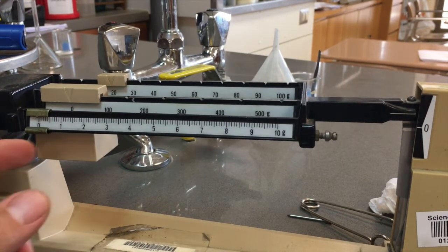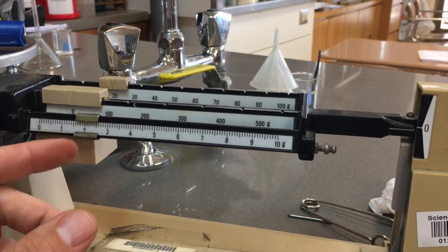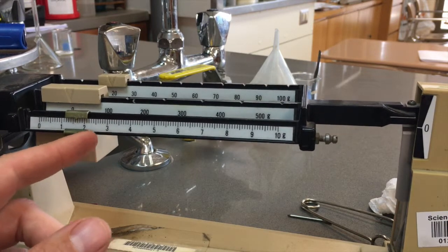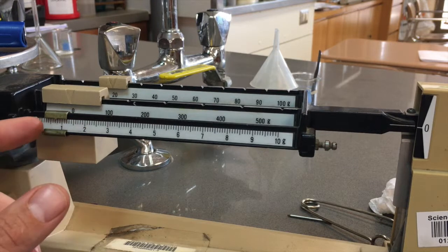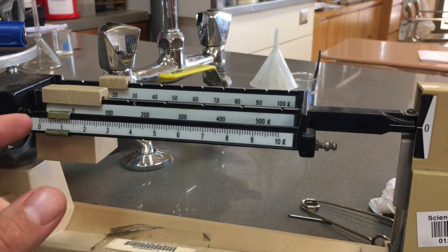So I'm going to put that back at 20, and then I'm just going to slide over my smallest slider to a point where I can get those lines matched up. Now you've got to be careful.